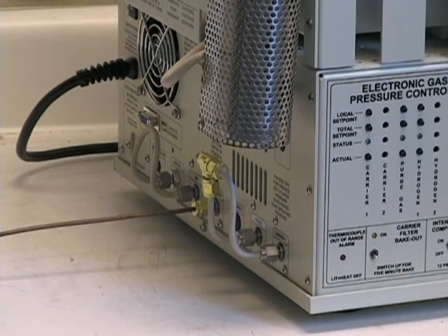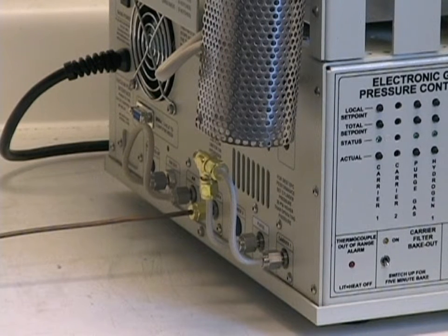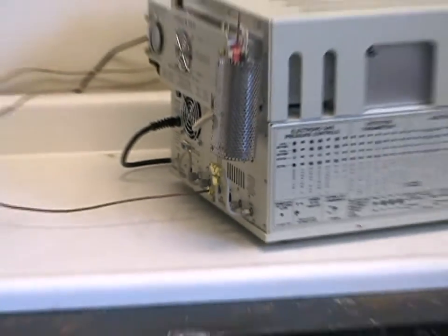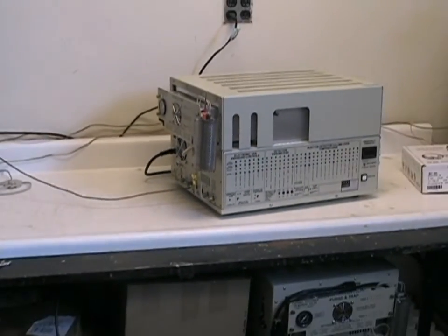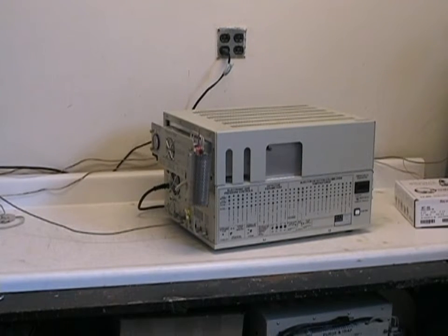Repeat this procedure for the helium carrier gas, which in this system is shown at the T, and then at the other side of the tubing to your gas regulators. At this point, we are now ready to plug in the GC. After our gases are hooked up, we'll go through the basic parameter setup.